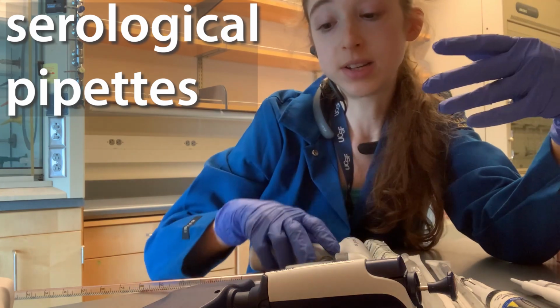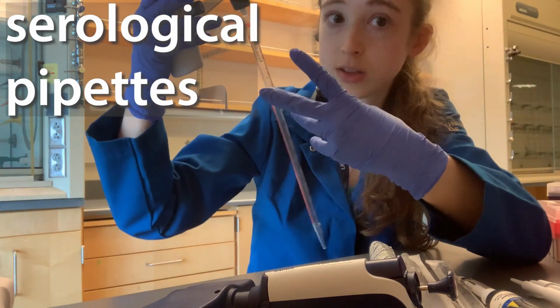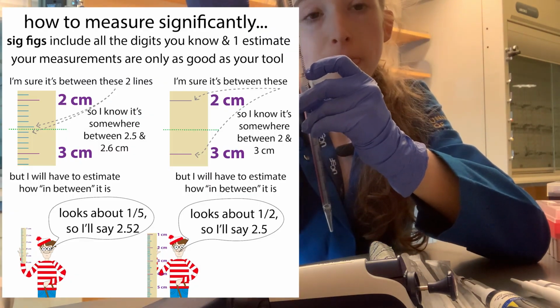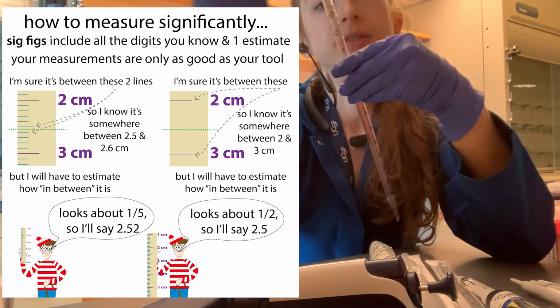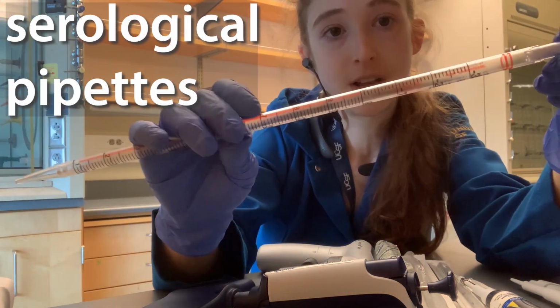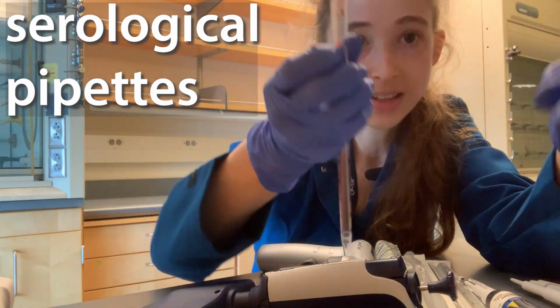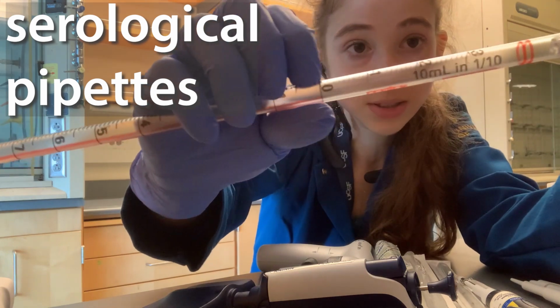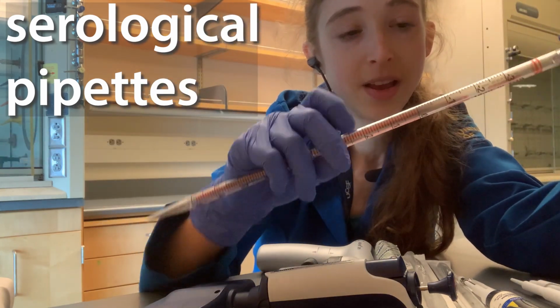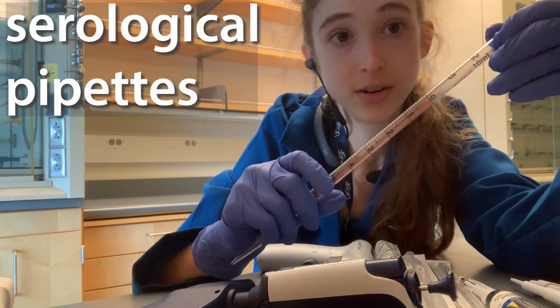When it comes to the serological pipettes, you also want to use the lowest volume, and this is for a couple of reasons as well. One is that the gradations are going to be closer together. So if, for example, we compare this 10 milliliter serological pipette, it's kind of confusing because they call it 10 milliliters, but then you can see that it actually goes up to, there's like 3 above it. It's like 11, 12, 13. So you can actually go up to like 13 milliliters in here.